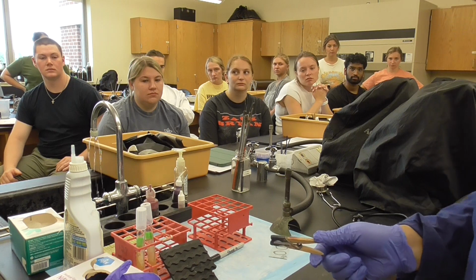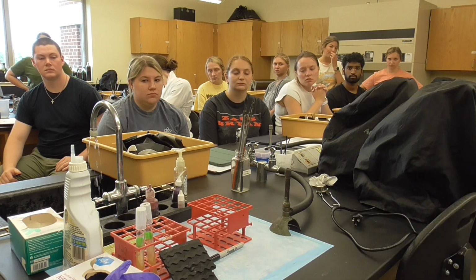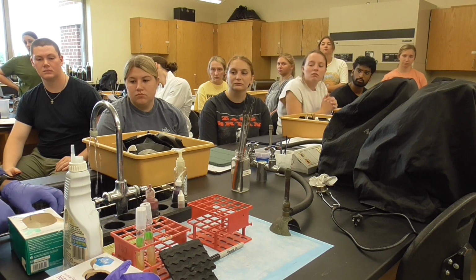Okay, now it's ready. This one I'm pretty much not going to use at all, so I'm going to turn it off. So we're going to go here. Then we're going to do the dye. So we're going to put it right here.